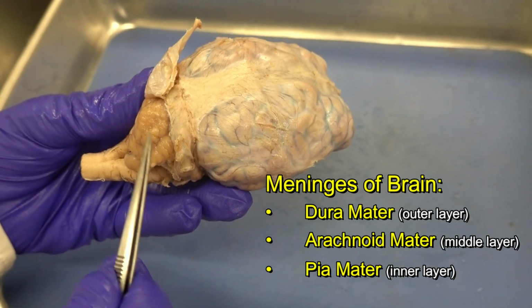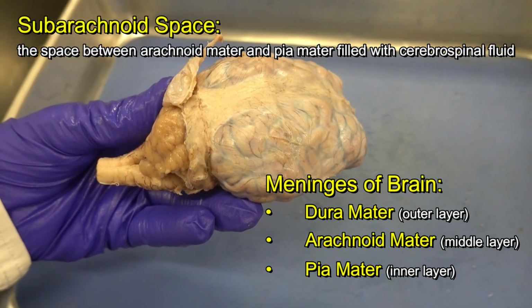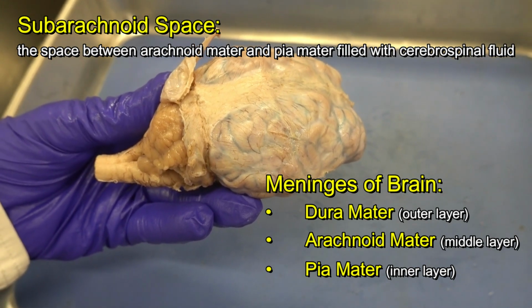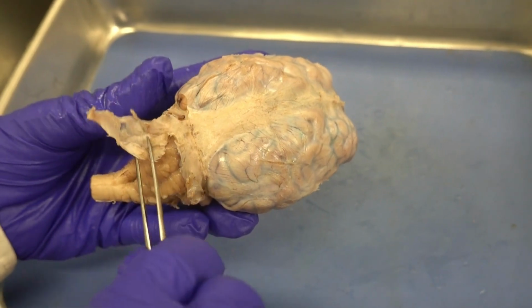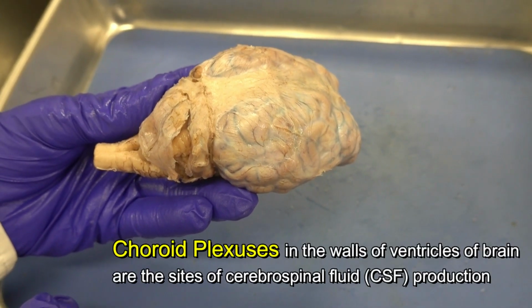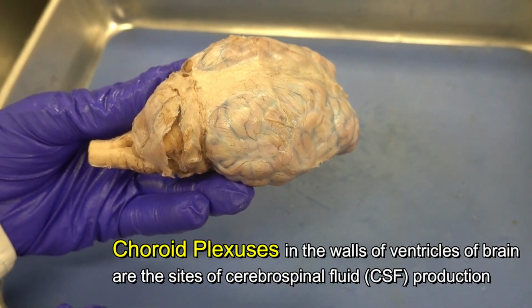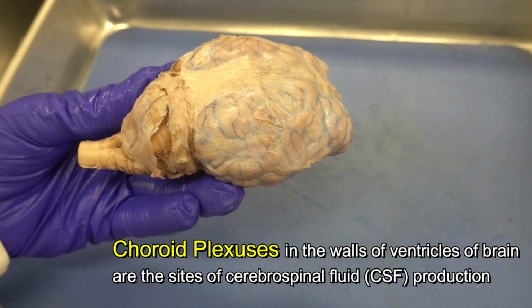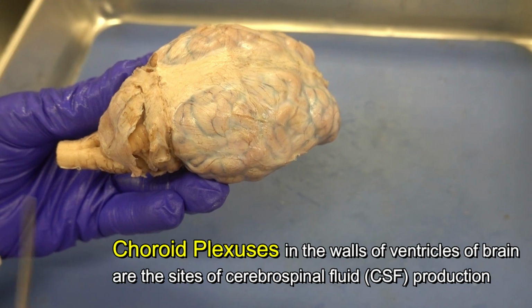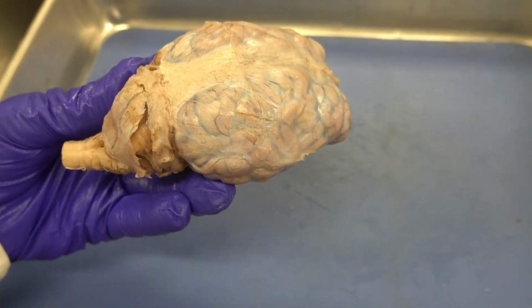Between pia mater and arachnoid mater, we have a space that is called the subarachnoid space. That's the space for circulation of cerebrospinal fluid. Recall that cerebrospinal fluid is formed in the choroid plexuses that we have in the ventricles of the brain. After I dissect the brain, I will show you where we look for choroid plexuses, and I will explain briefly what they are.